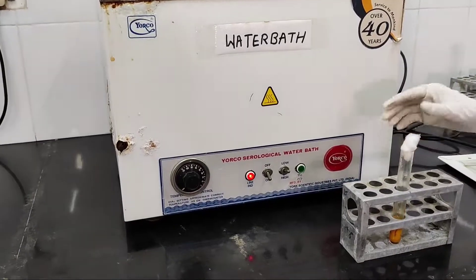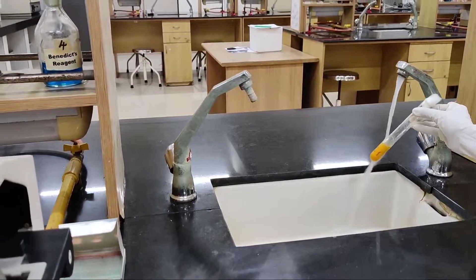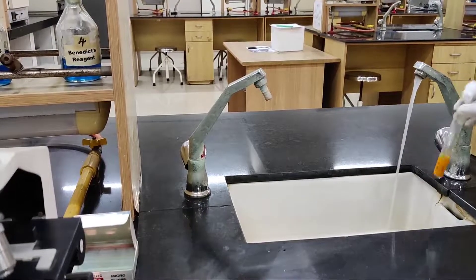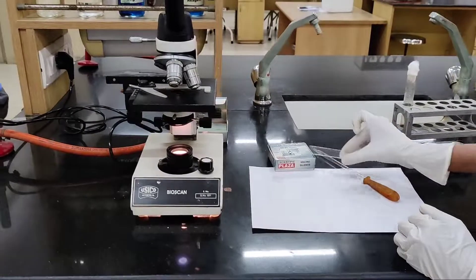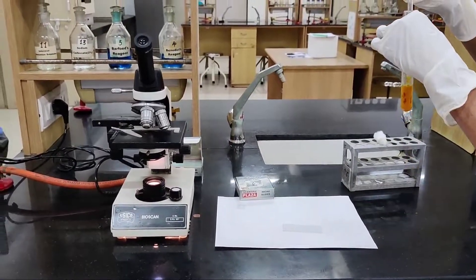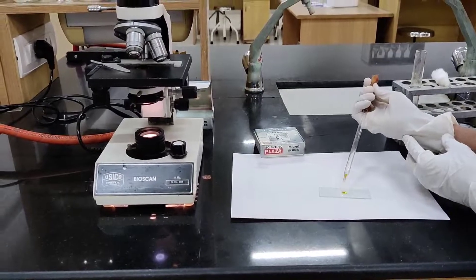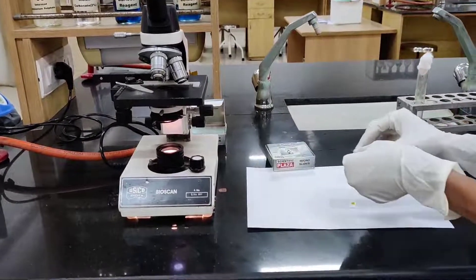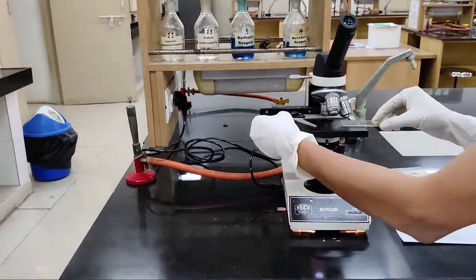Now cool down the test tube under running tap water. After cooling, mount the crystals on a glass slide with the help of a dropper, taking the crystals out from the test tube. Apply a cover slip on it and then examine under the microscope. This is how you perform the osazone test for carbohydrates.